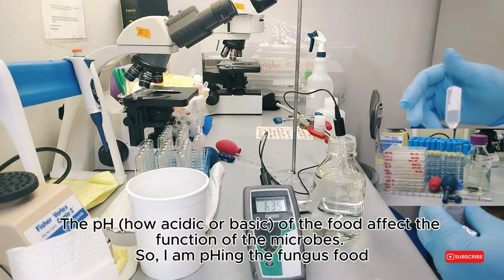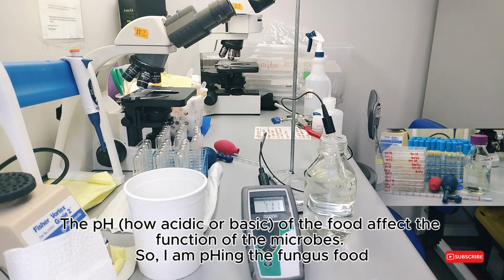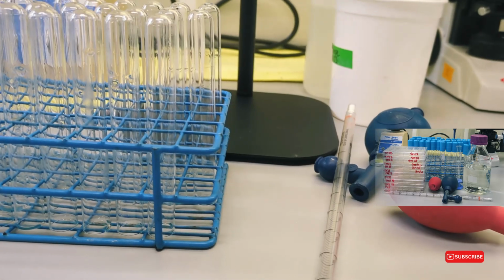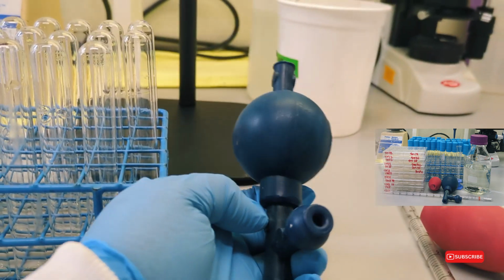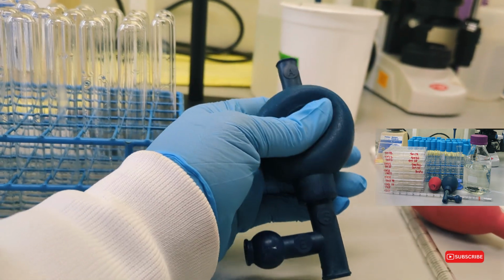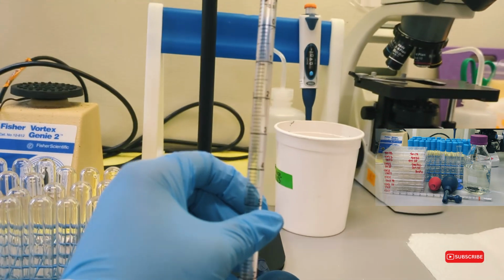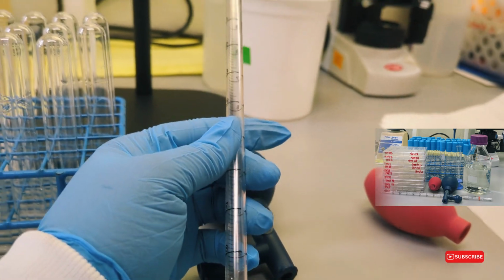The pH, how acidic or basic the food is, affects the function of the microbes. So, I am pHing the fungus food. It was definitely not on my bingo card that in 2025 I would be using an old school pipette filler to dispense liquids. That is crazy.